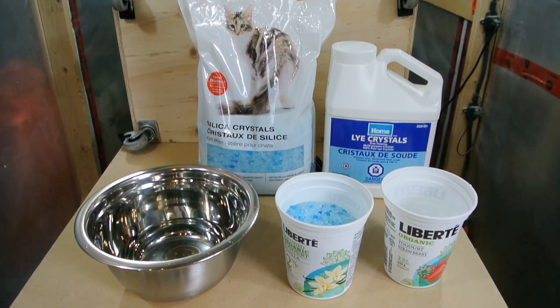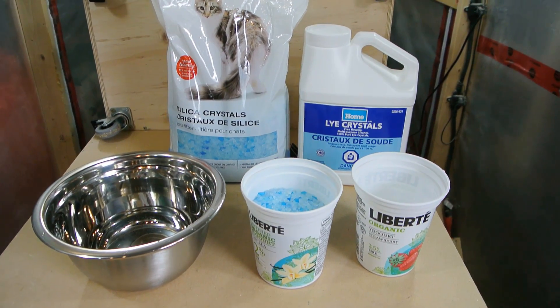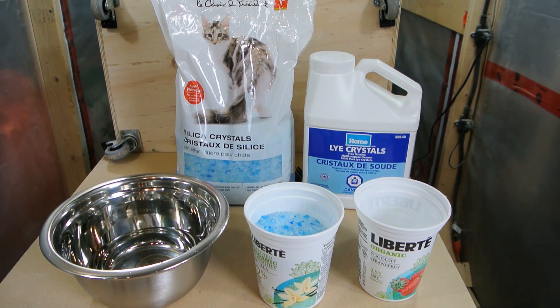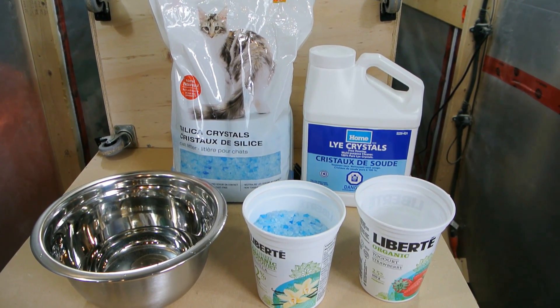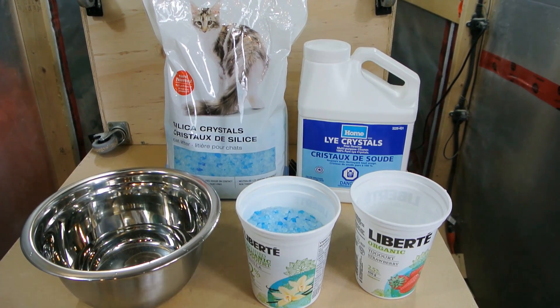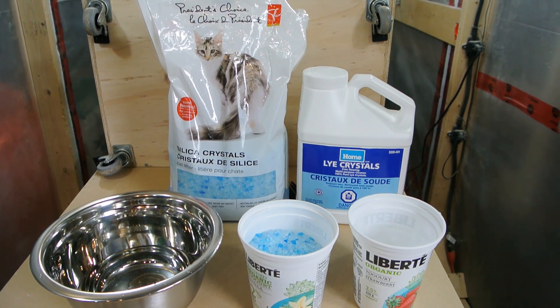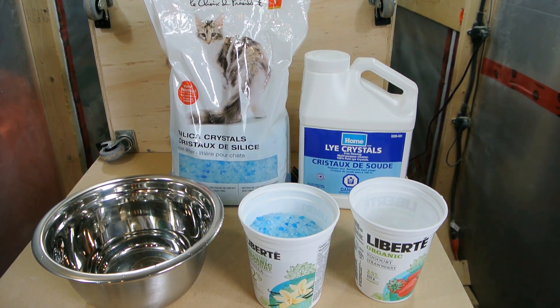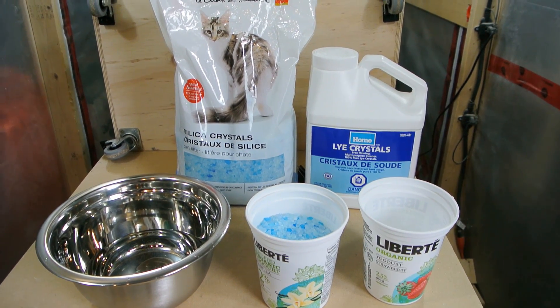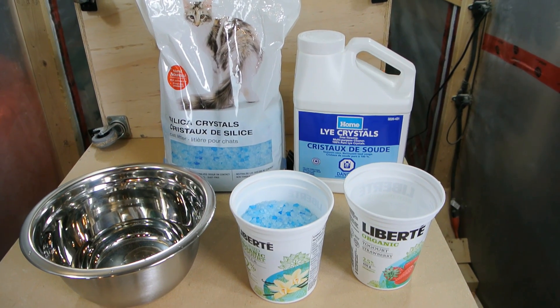In this video I'm going to attempt to make sodium silicate, also known as water glass. It's a high heat glue and I'm going to use it probably for refractory - that's my idea anyway after watching some videos. I'll post the videos where I got this idea from in the comments below if you want to see the original. This isn't my idea, I'm just following someone else's direction.